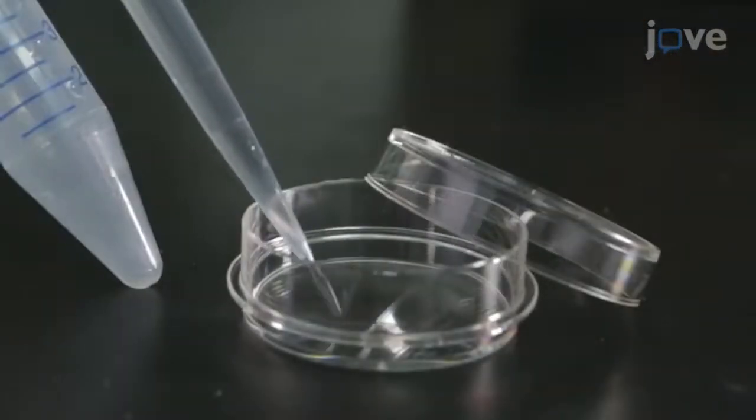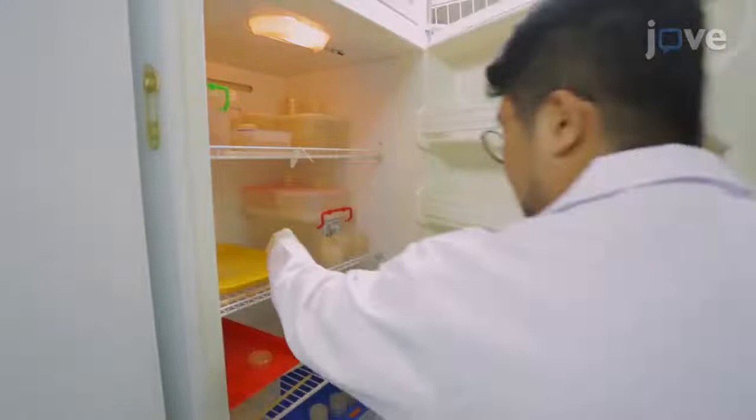Transfer the eggs to a 3.5 cm dish and incubate them at 20 degrees Celsius for one night.